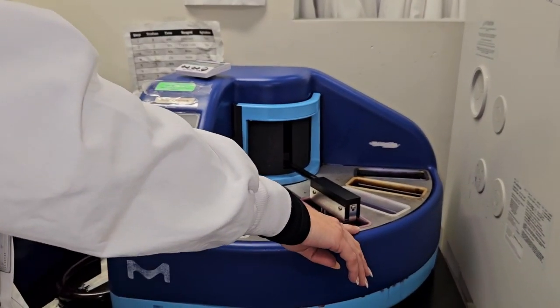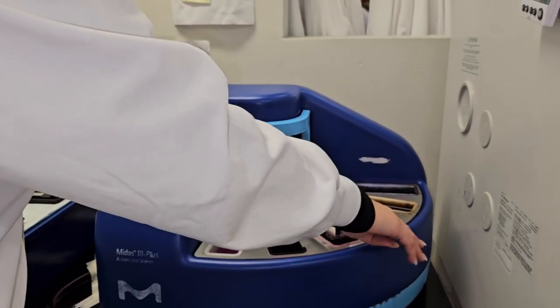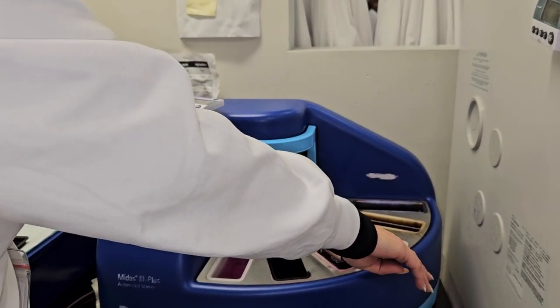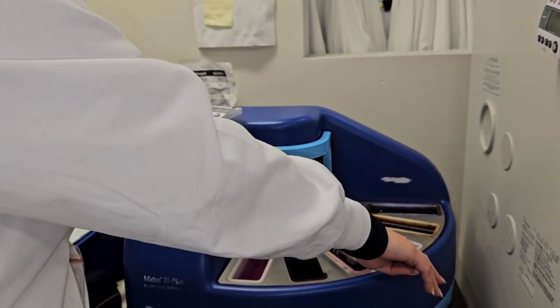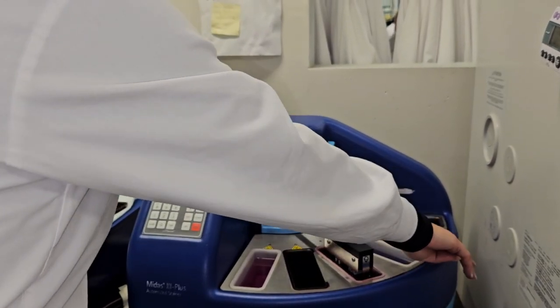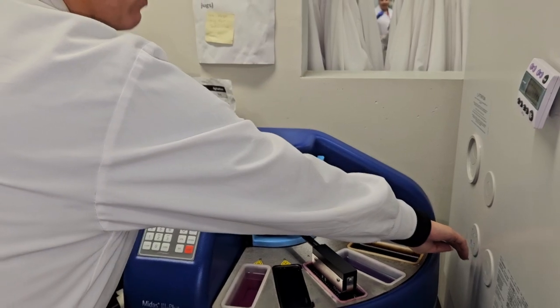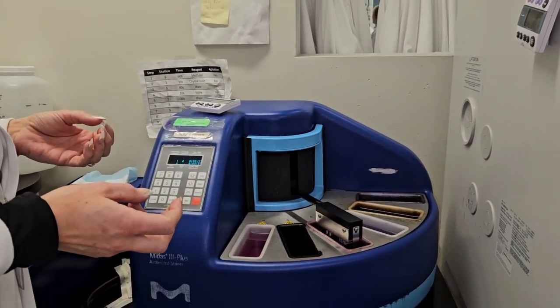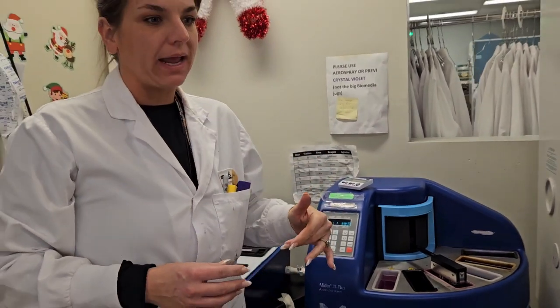This is safranin, our final stain color. This is what stains our background pink. This is our decolorizer. This is when you will see all the crystal violet iodine complex leave the cell wall of gram-negative bacteria. Iodine is our second stain that we use. Crystal violet is the first. This is the most important factor in determining if an organism is gram-positive or gram-negative.